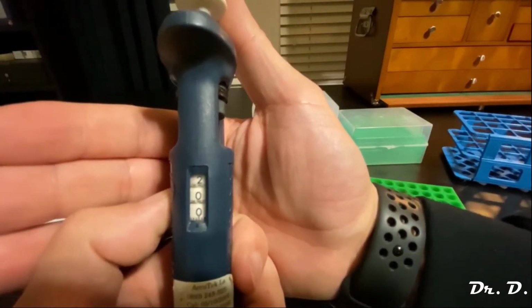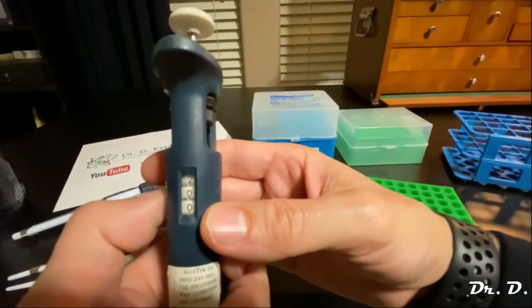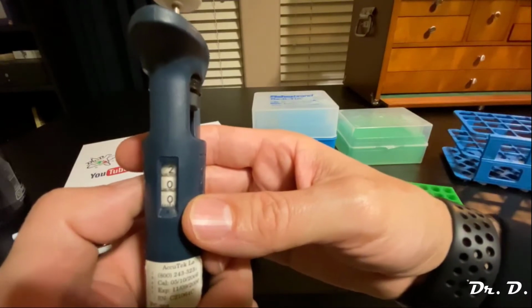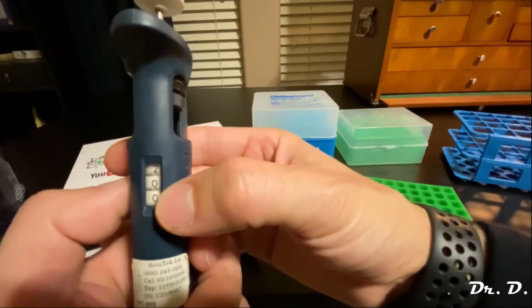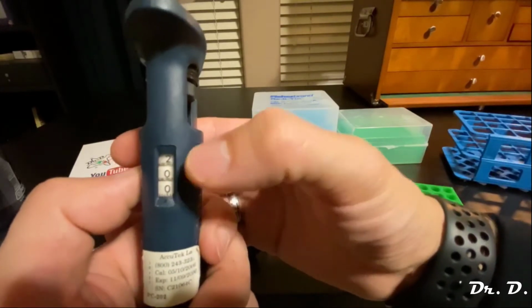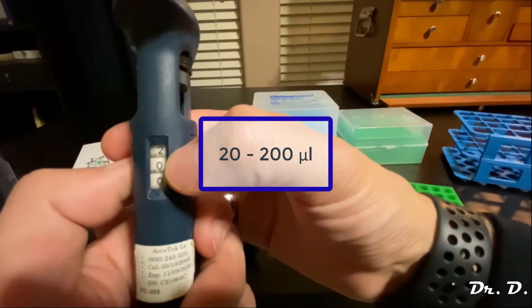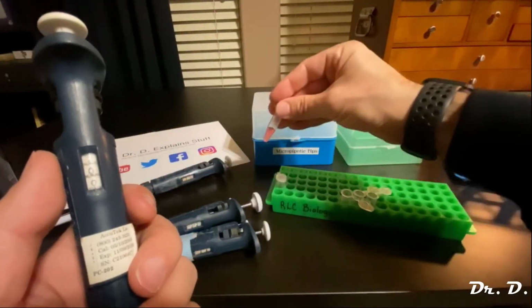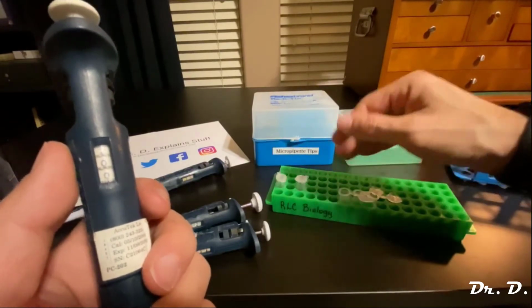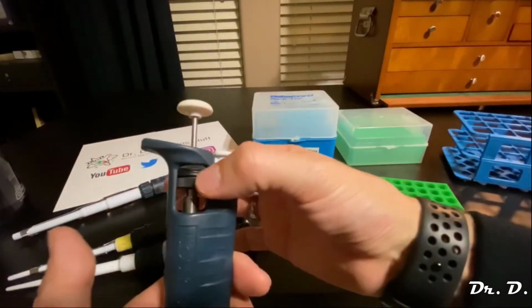And if you were to guess, what would be the lowest that you could set this to and still be accurate? Do you guys remember the rule of 10%? So 200 is the maximum. What's the lowest you could go with this Pipetman? That's right, 20 microliters, right? And how much did I say I want to transfer from this to the next tube? I said 80, right? Okay, so let me turn this. Again, this wheel turns.